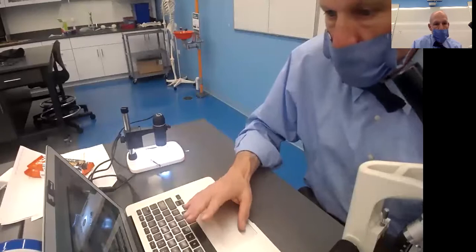But the nice thing about this one is I can put this under, I can plug it into the computer, and there obviously is a nice picture of Penny, right? There's Abe, there's the word Liberty.